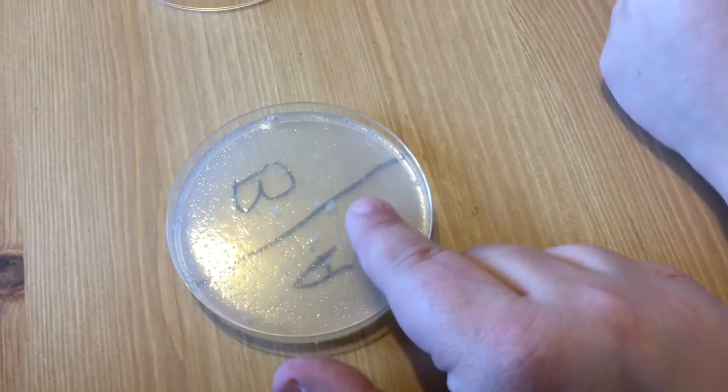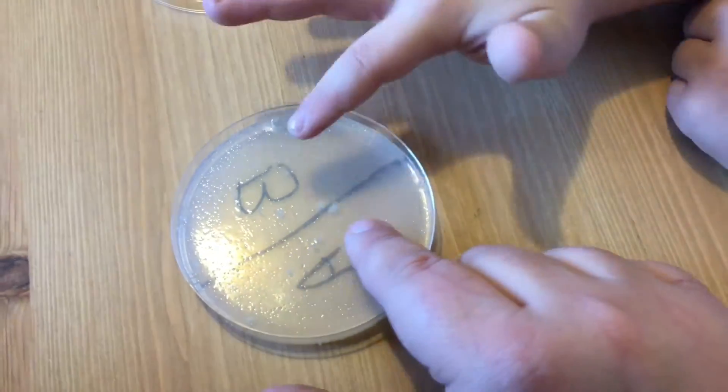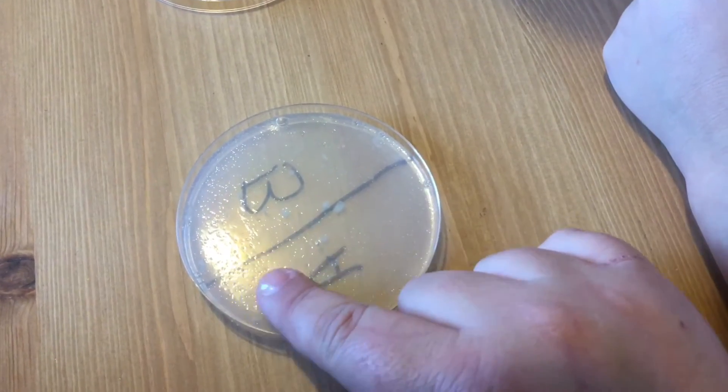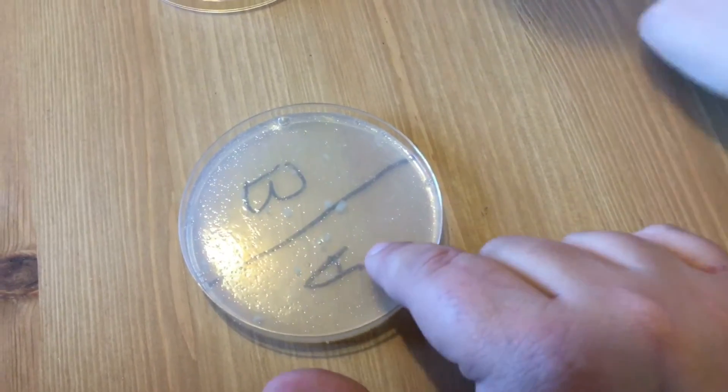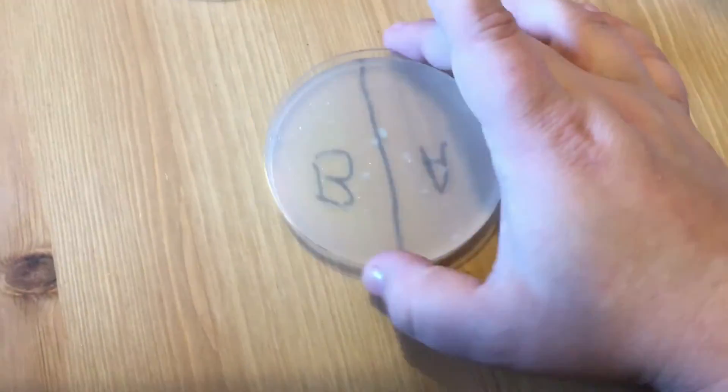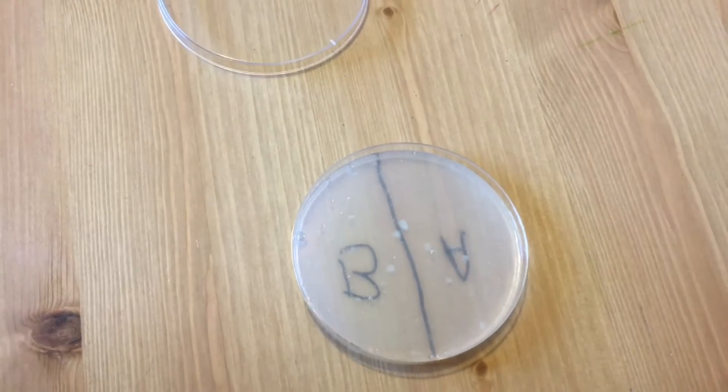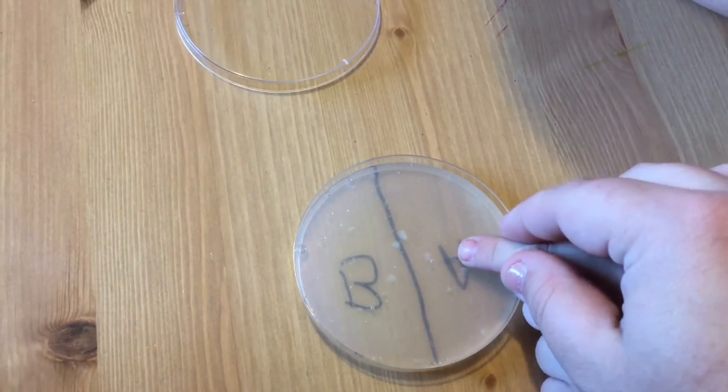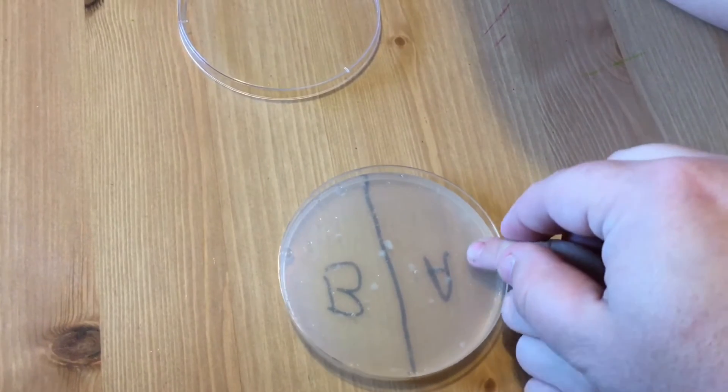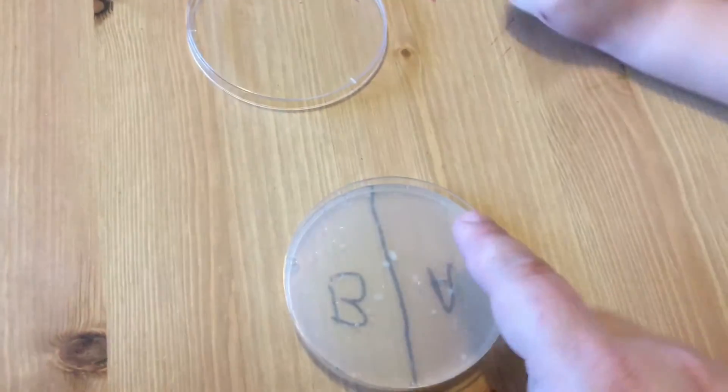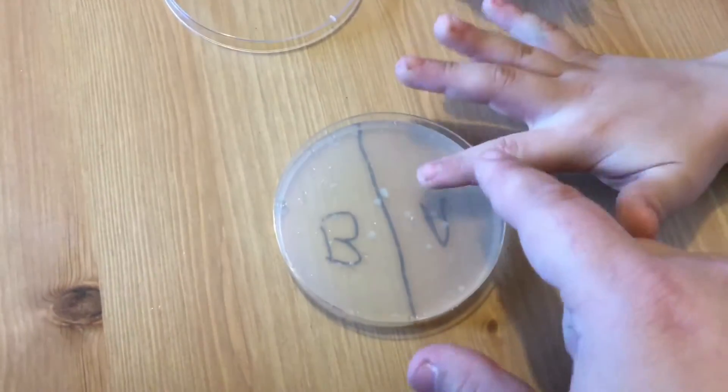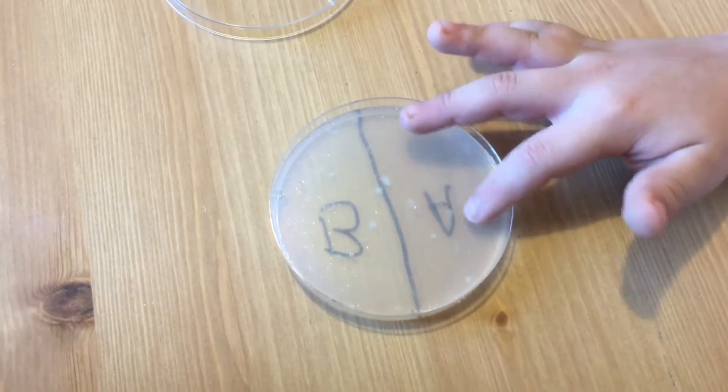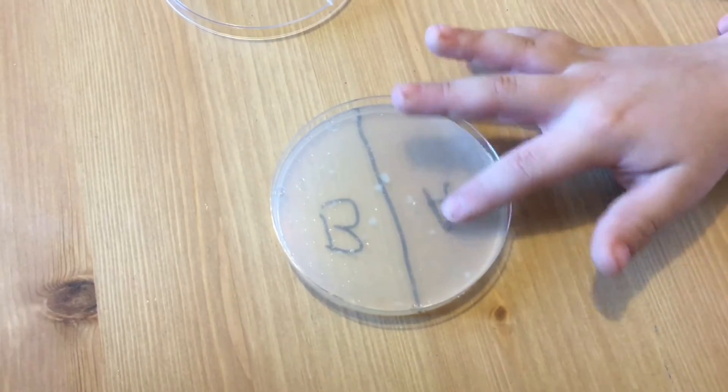Gentle, like you're petting. Hold on, no, no, no, hold on. Like you're petting like an animal or touching a new baby. Now what you're going to do, give me your finger. No, it's just cold. You're just going to be gentle, so gentle. You see that? Can you just stay on the A side here? I'll do it real gentle and then we'll go do the soap.